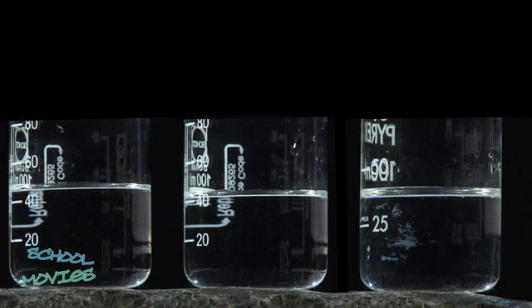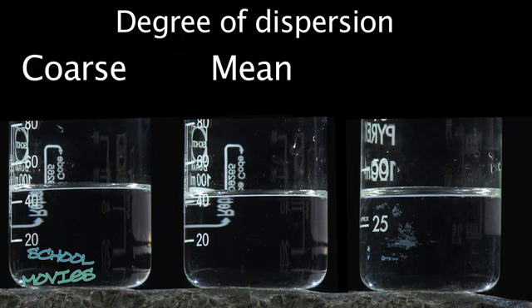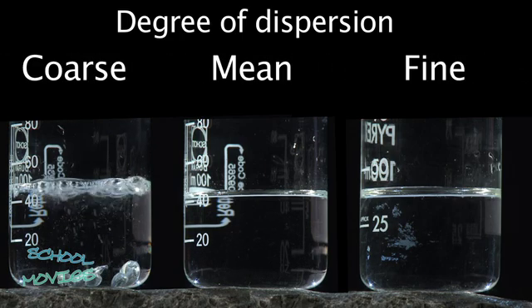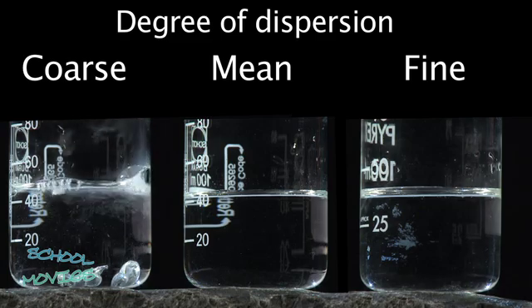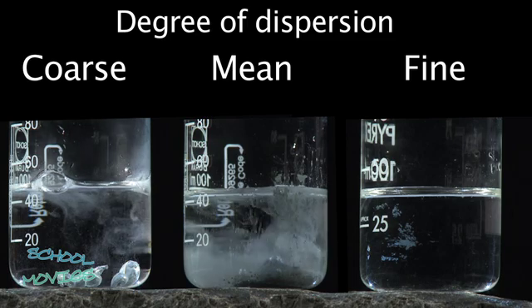These three containers are now filled with hydrochloric acid of the same concentration. Zinc is added in different degrees of dispersion. With the compact piece of zinc, almost hardly any reaction can be observed. Zinc grains result in a stronger reaction, as seen in the formation of gas.